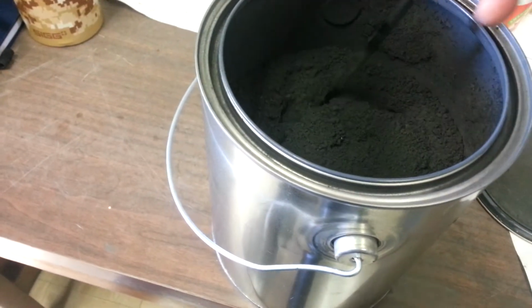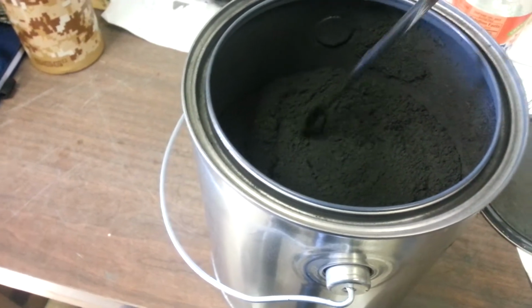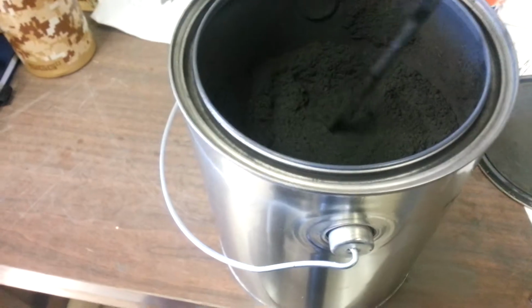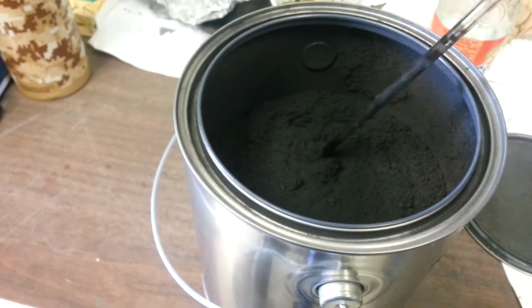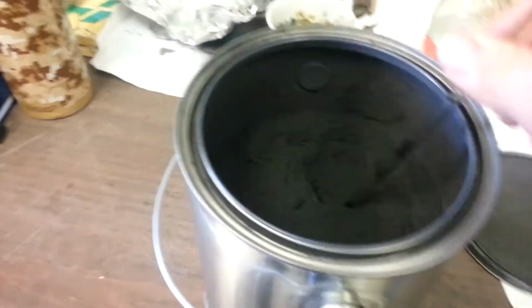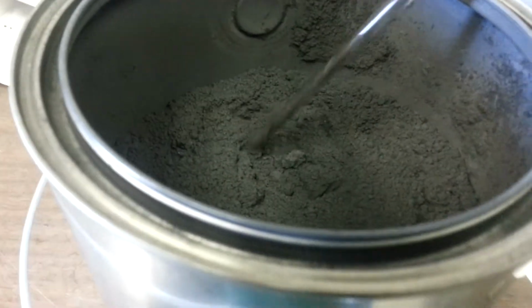And it is very light and fluffy powder. There's a couple spots where it's bigger and still clumped together. Not necessarily the same as what was in the cake when we process it, but it is what it is, and it's very neat. Lots and lots of graphene. Look at that, and it comes out. This is what's so neat about it.